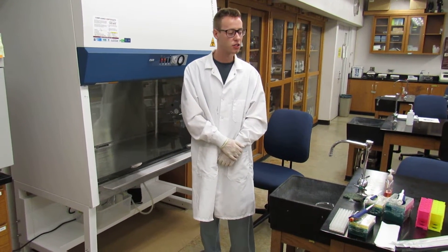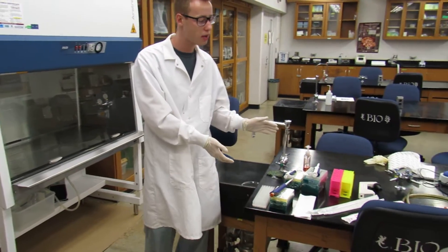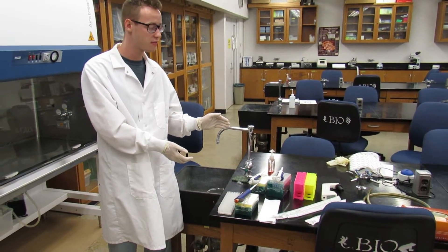Good afternoon. Today we're going to learn about the basics of cell culturing. To start, we're going to want to gather all of your supplies so you're ready to go within the biosafety cabinet.